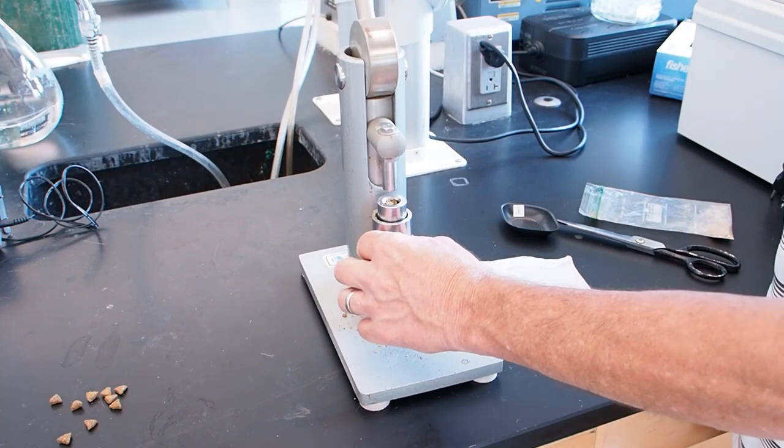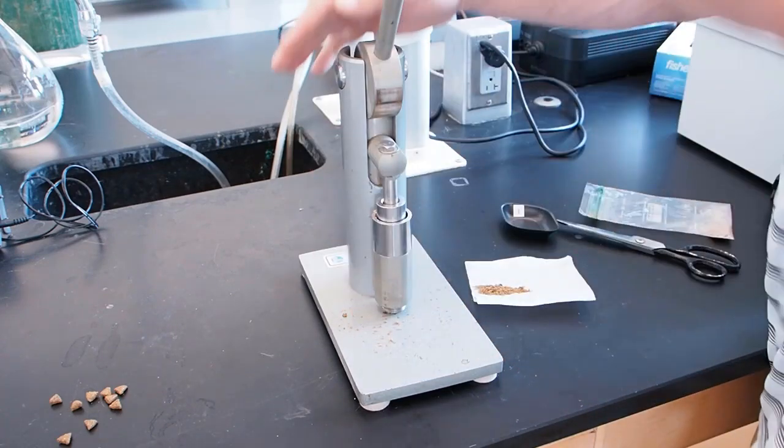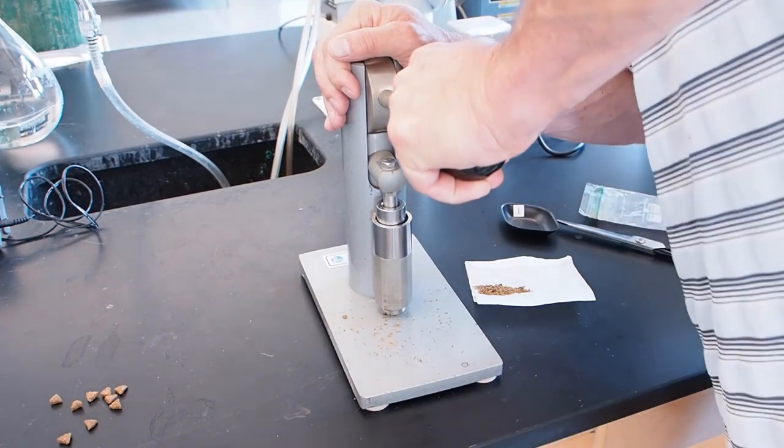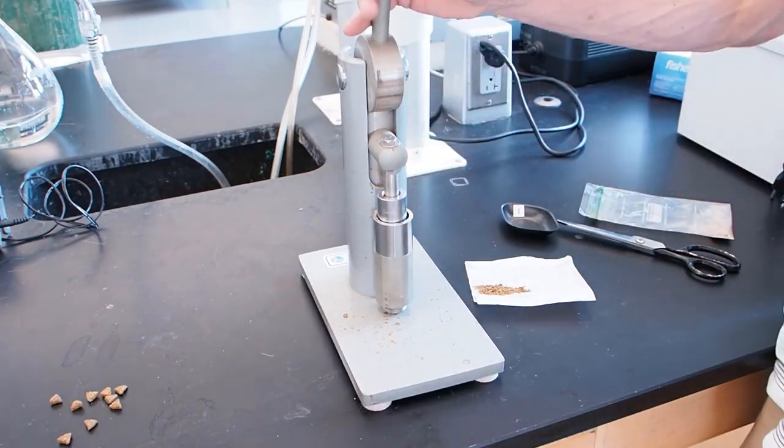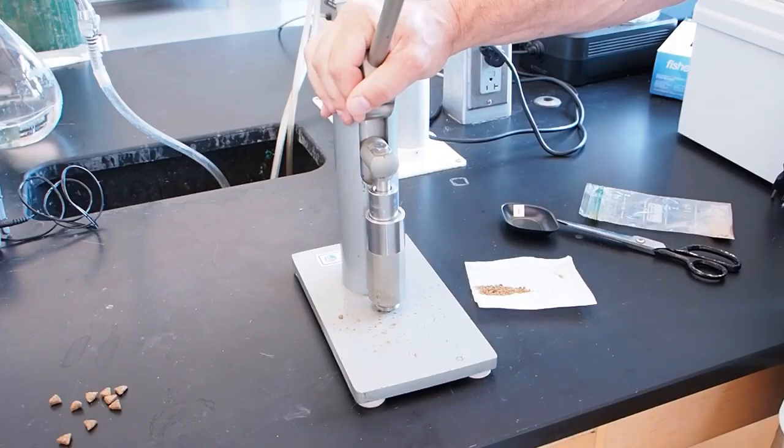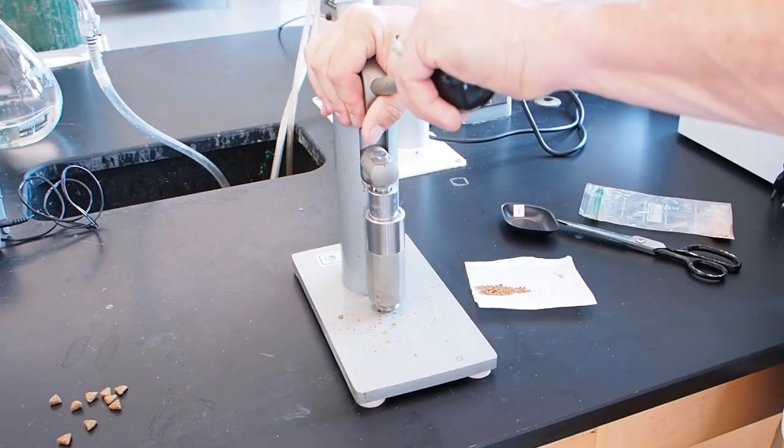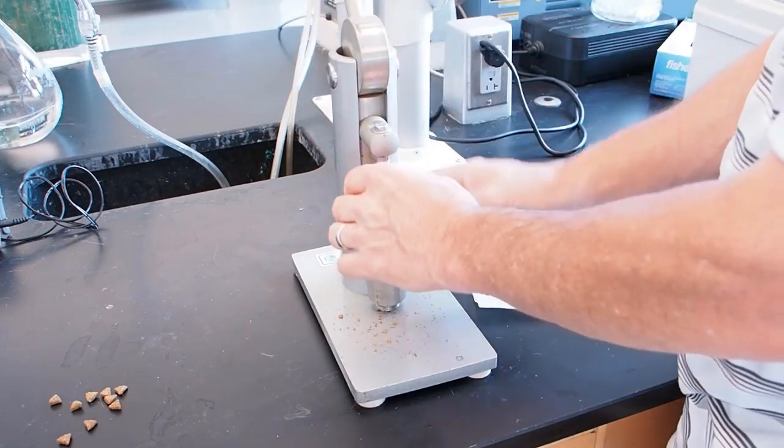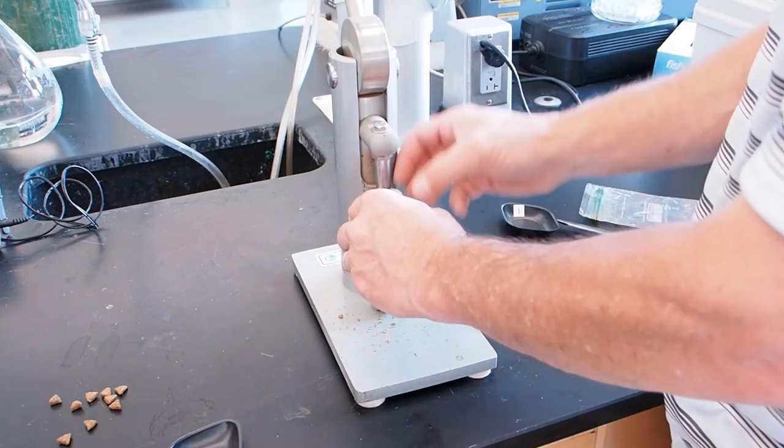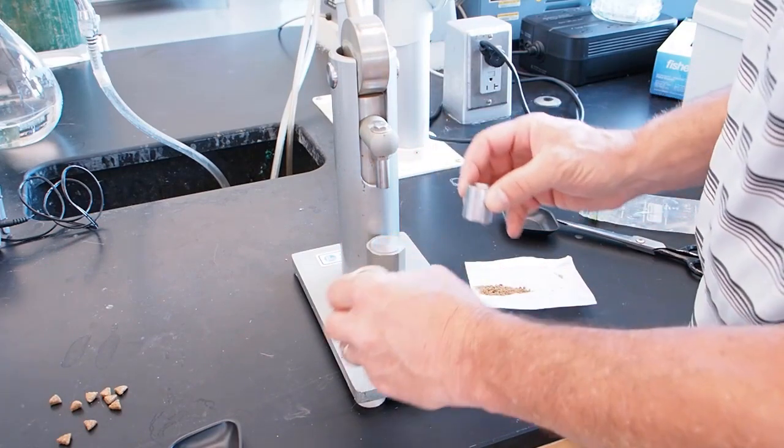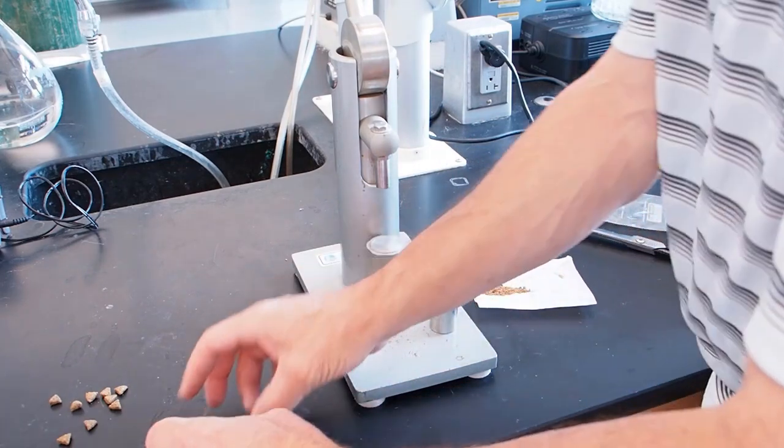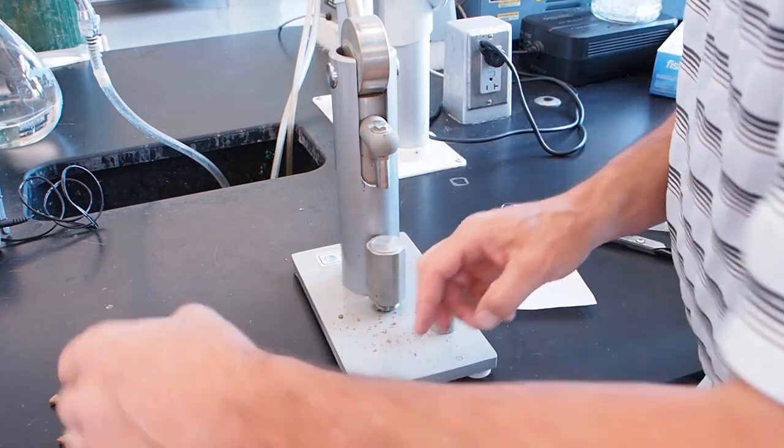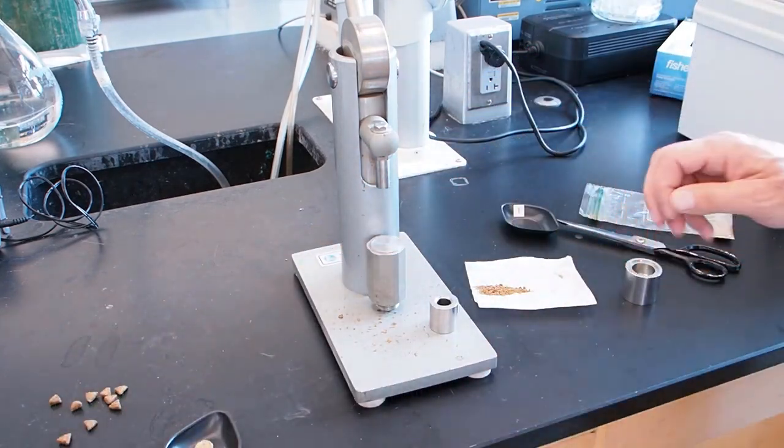You can measure it in here. Okay. I'm going to put that on here. It's on tightly. And then we're going to push this down hard. Okay, now to the pellet. It was really stuck at the top. I didn't, it was good that I caught it before it started releasing the pellet. And lift it up. Yeah, put it in here and then weigh it. But don't do too much because I'm not sure how compact that will be. Wait, wait, we want to be careful. But it looks good. I think it will be cool.